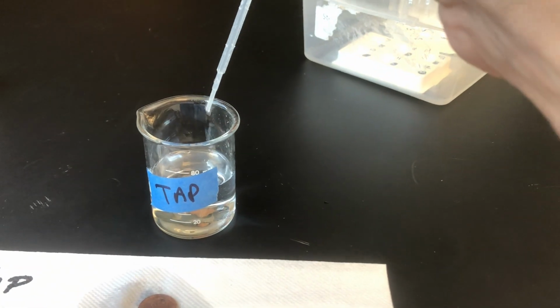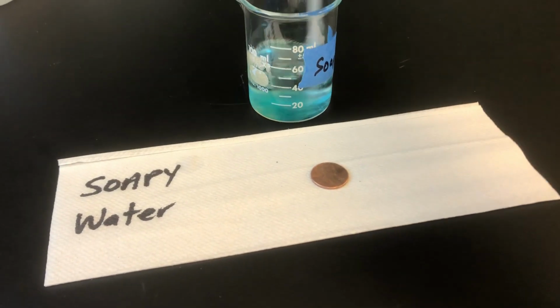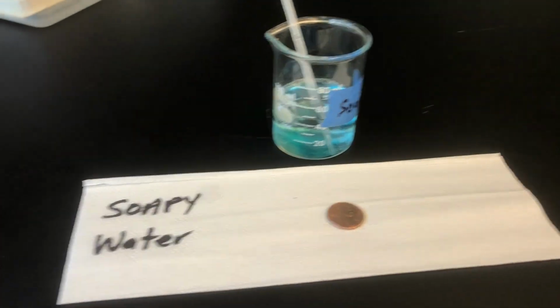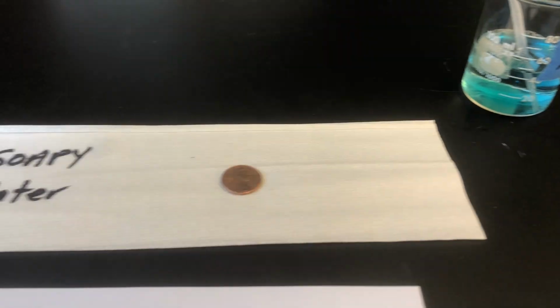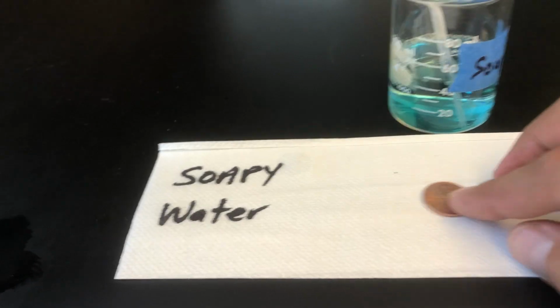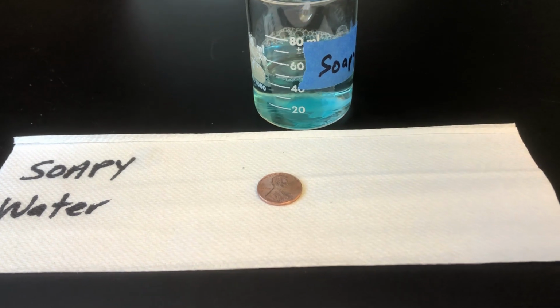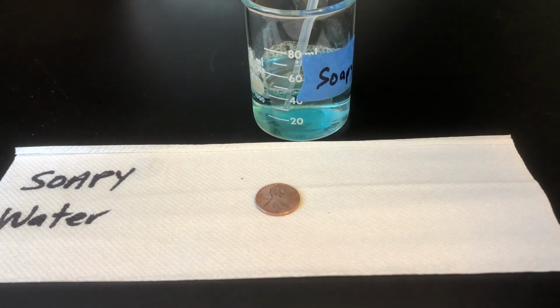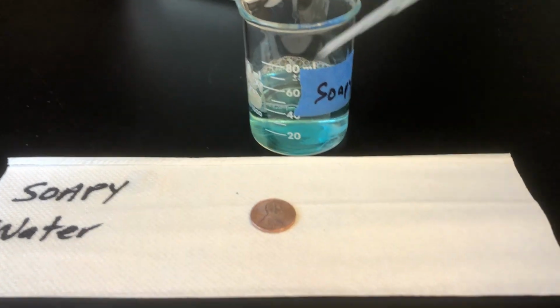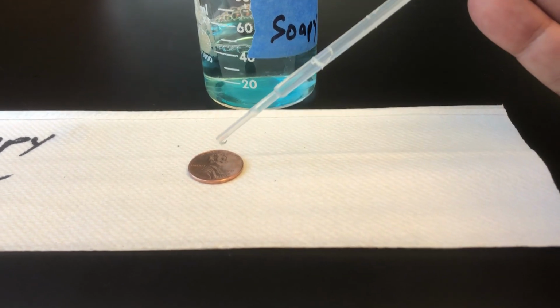Now I'm going to do the same thing, but the difference is I'm going to get rid of the tap water from the eyedropper, and I'm going to come over to the soapy water. I'm going to do the exact same thing. Let me stir up the soapy water a little bit, and move this stuff out of the way. You can see there goes the wet paper towel mark. Okay, same thing, only now I'm going to use the same eyedropper and suck up the soapy water. And I'm going to start counting how many drops of soapy water. And so here we go.